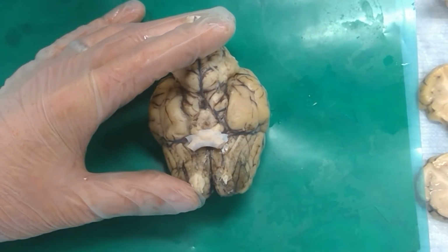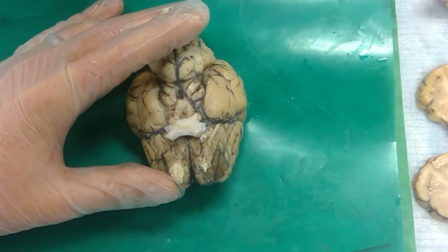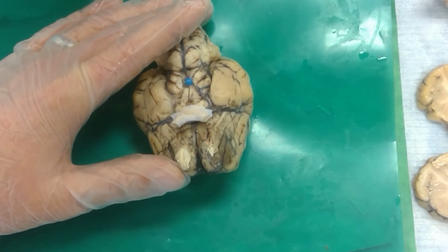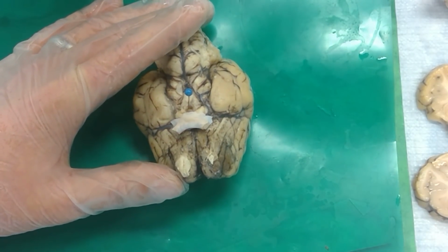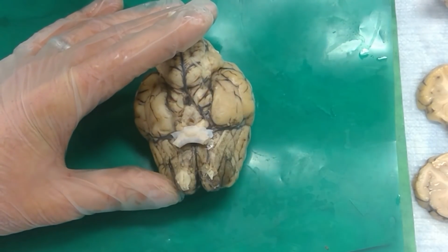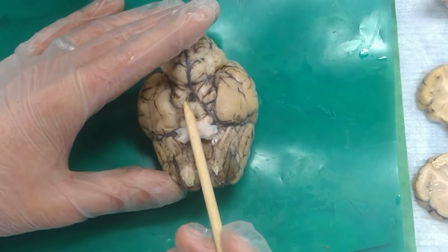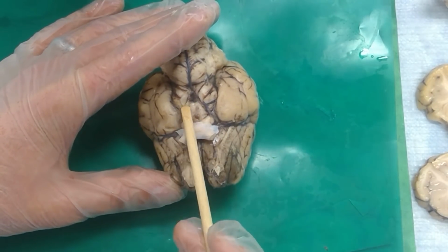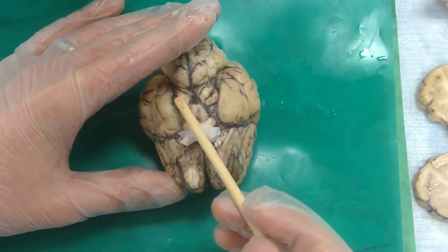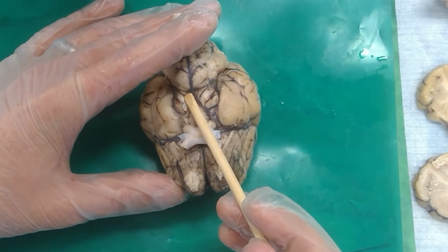All right, and so if we had a pin that was going through right here, and we said name the space inside the brain that this pin is going through, and what is the tissue that's surrounding this pin? Median eminence. All right. And this structure right here that's just behind that. Mammillary bodies. And then these flappy fettuccine noodle things. Oculomotor nerves. And which encephalon are those attached to? They are attached to the cerebral peduncles.